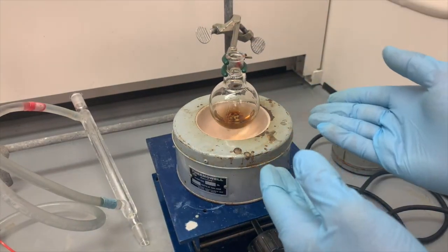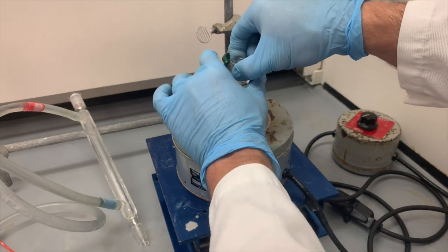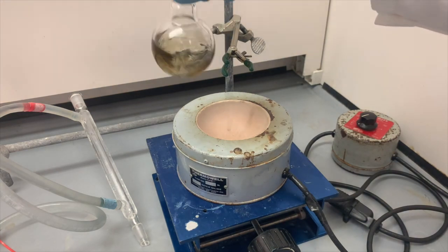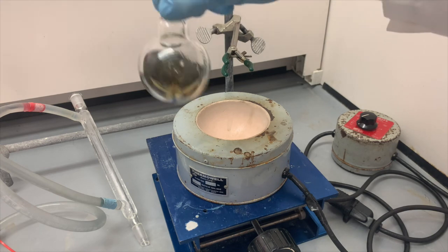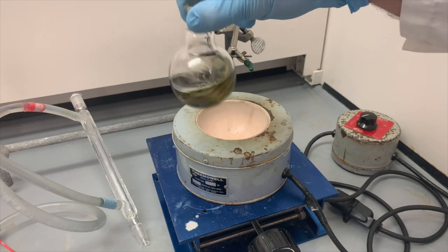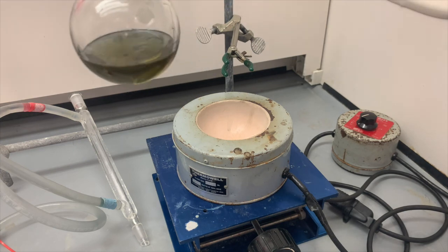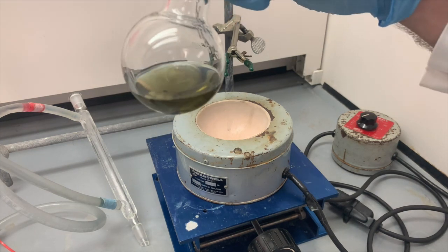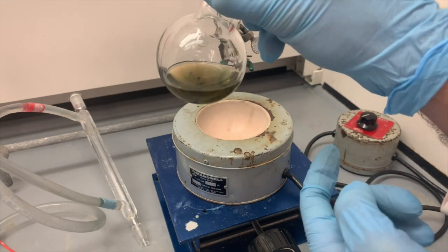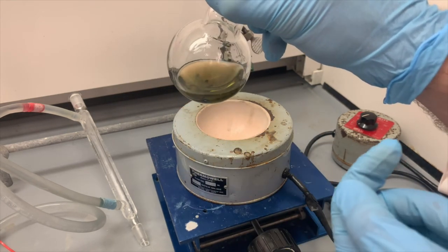As I said before, usually you would have a stir bar in there and that would just start stirring, but we don't have that for this particular experiment, so I'm going to take it out, give it a little swirl, try to get as much of these materials to dissolve as will dissolve. Look, we have the development of a greenish color. It kind of looked brown when I first added everything, and now it's turned green. And if we look carefully here, you can see that there are sodium hydroxide pellets still in there. The naphthol has pretty much completely dissolved as far as I can see.